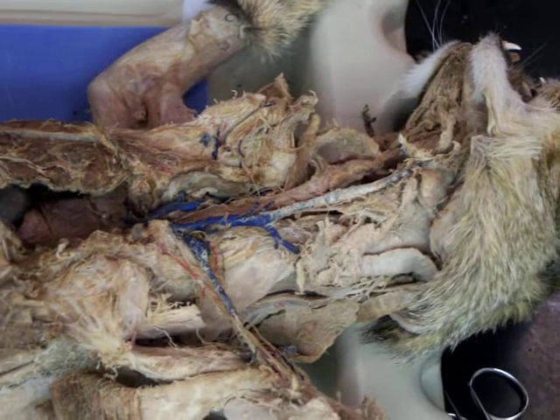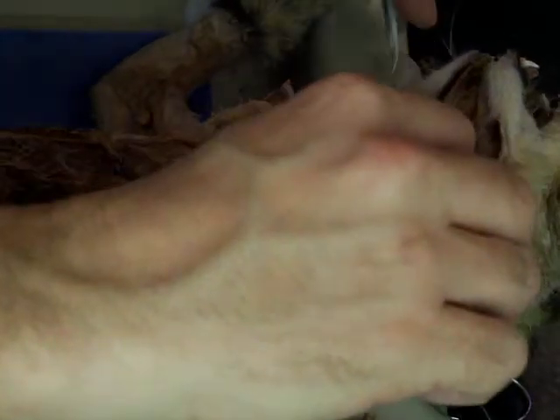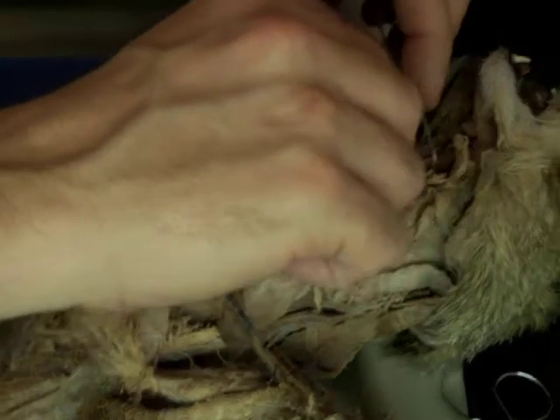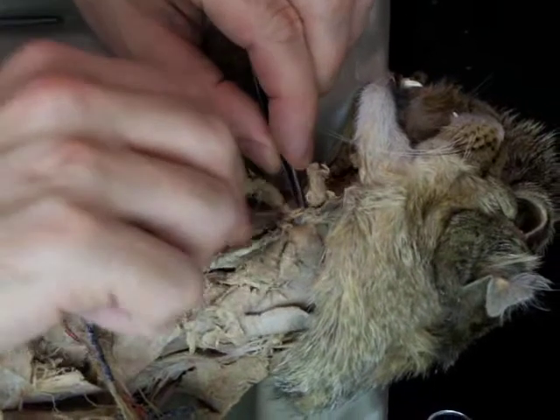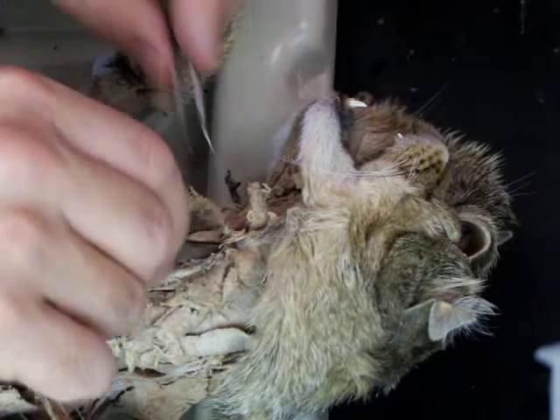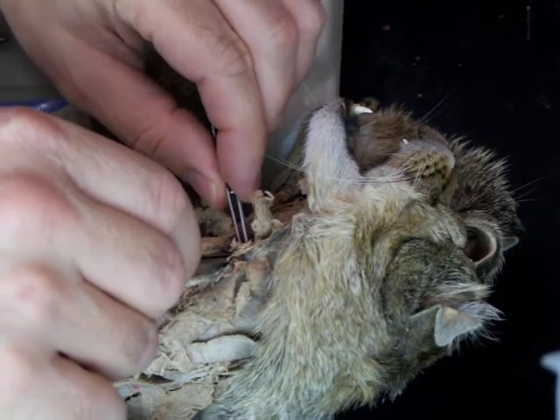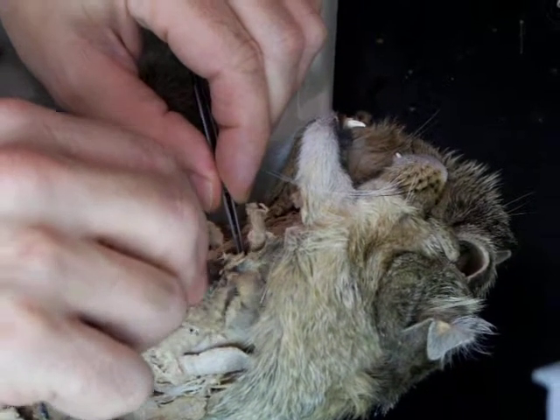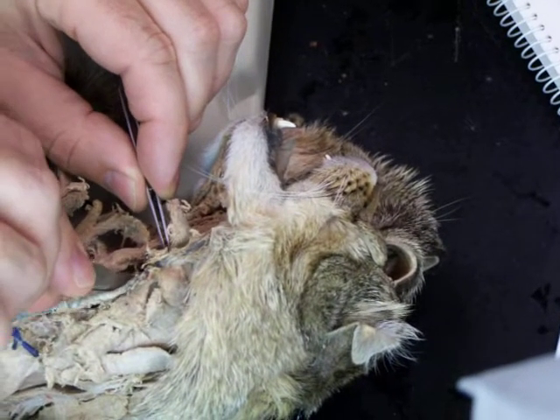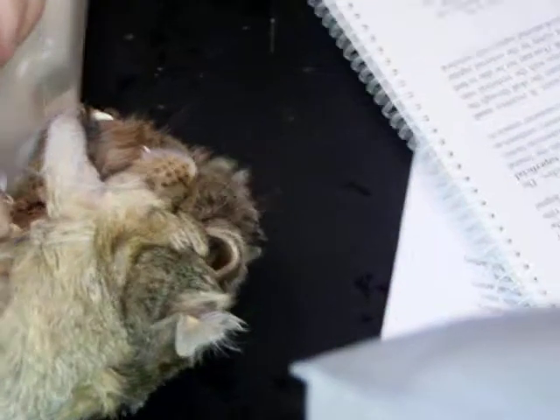And unfortunately, on a cat this size, they're going to be pretty darn small. And so you can see, as the common carotid comes up, before it gives rise to these vessels that go up to the head, you're going to have vessels that go into the tissue. This one here, you see this one here? Looks like that's the occipital. You follow it around, it goes over toward the base of the skull, toward the occipital region. The occipital is going to go straight in from the common carotid.